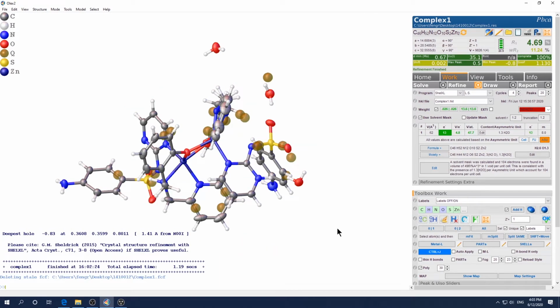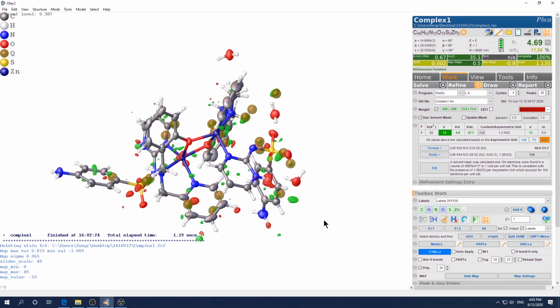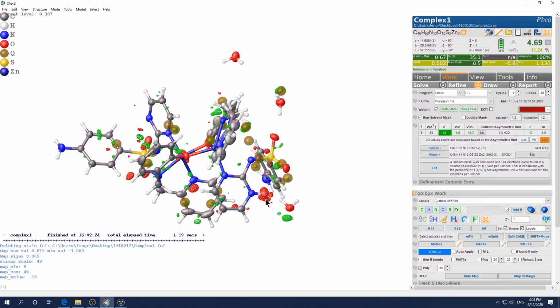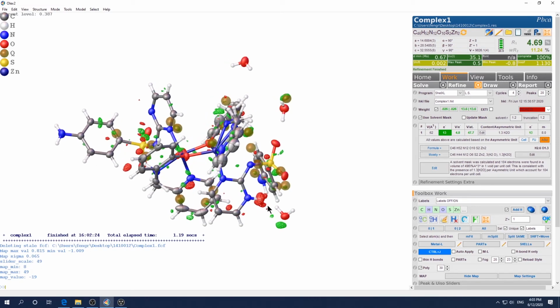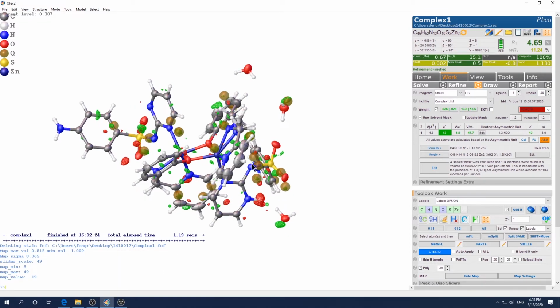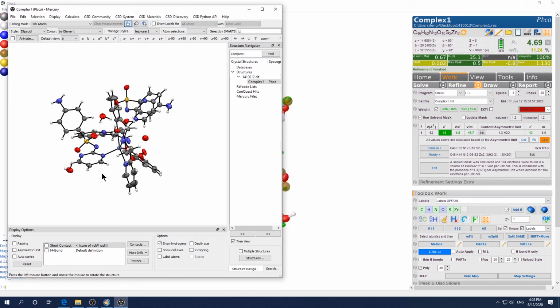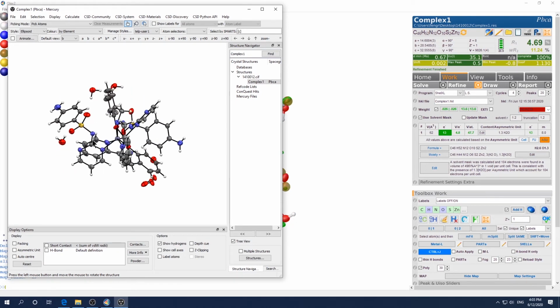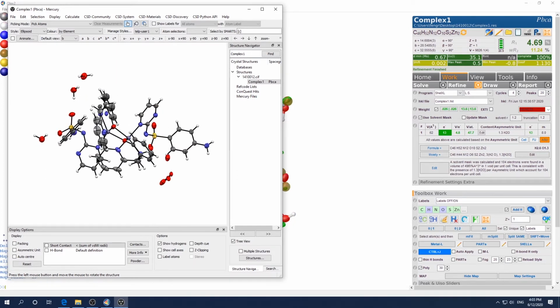And check Ctrl M to bring up the map to see if any outstanding holes here. Yeah, there's big holes here. That means this proton is probably should not be there. So let me check the original model to see. This is a sulfamide and pyridine. See, look at this. Yeah, there's no proton on this nitrogen. Again, this is an aromatic ring, so it should not be a proton there.